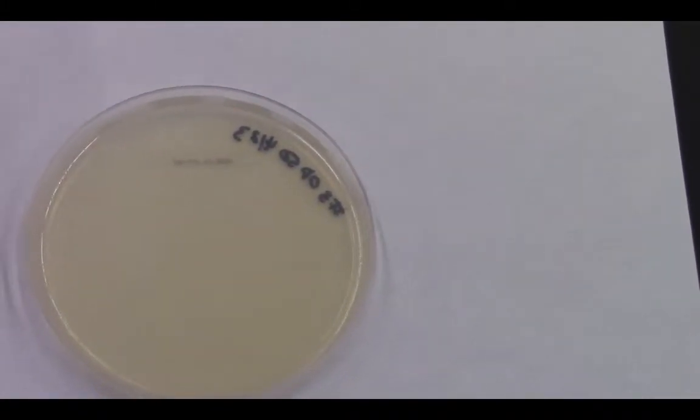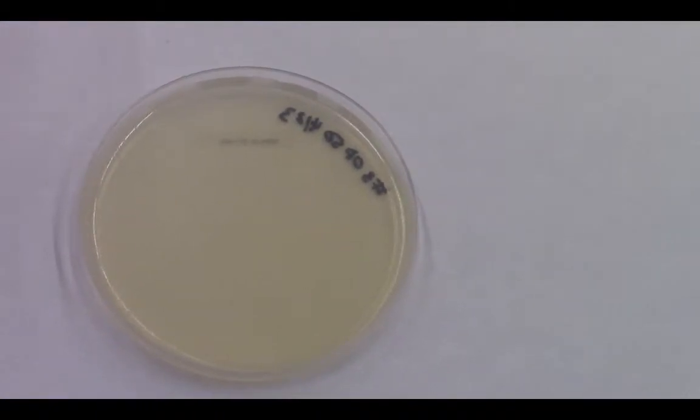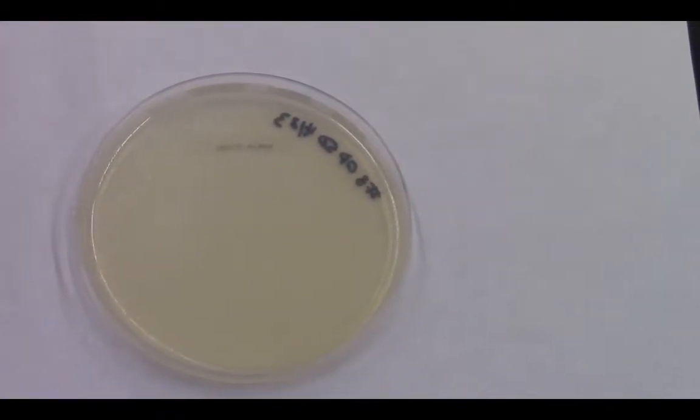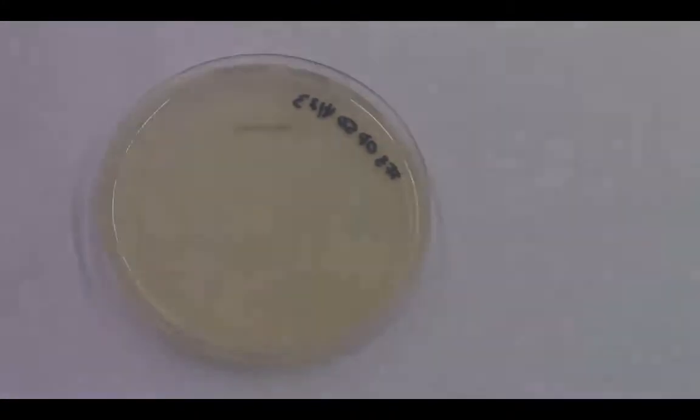And you can imagine that because the worms are so small, we can keep hundreds on a petri dish like this, so that we can keep many, many, many in our lab incubators.